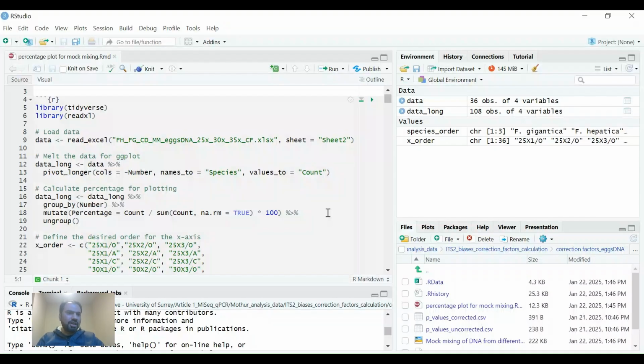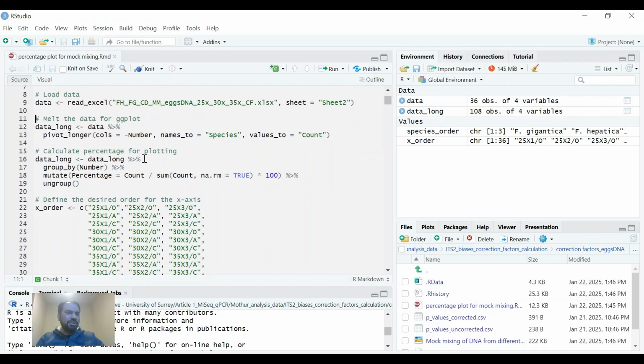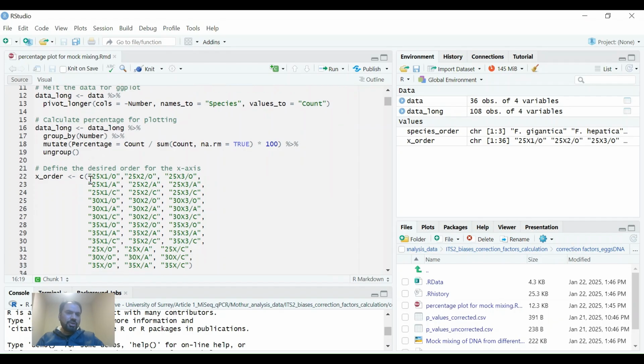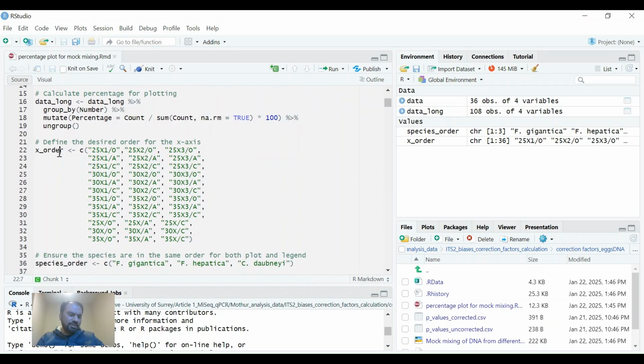Here is the R code that I have generated already, just to show you that we are using tidyverse and readxl, two libraries for generating the bar chart diagram. So first of all, we will give input data to R. It will read sheet 2 where we have put all our finally identified data, and then we will use melt data with ggplot and the data long command, which will read all the data, and then it will calculate the percentages for each of the groups and each of the 4 variables that we have put into the Excel file.